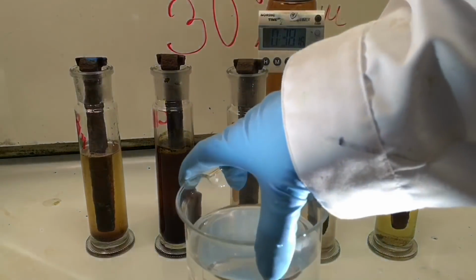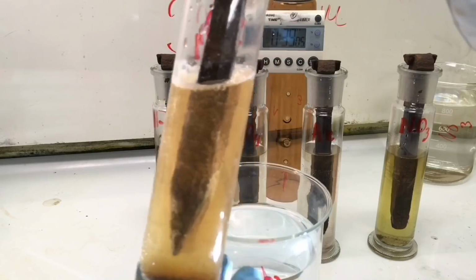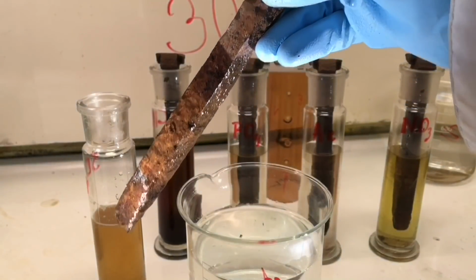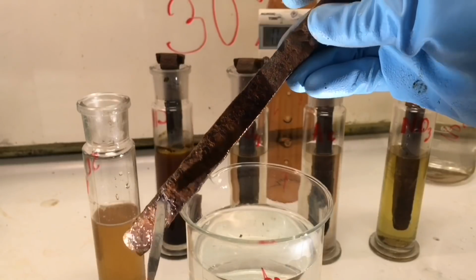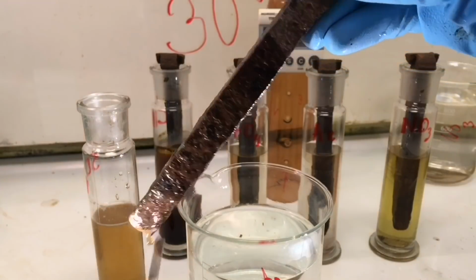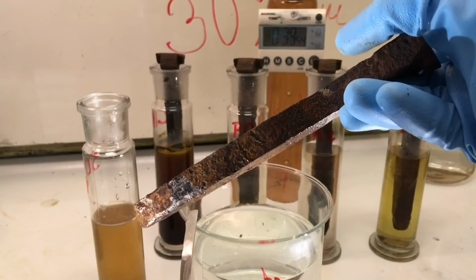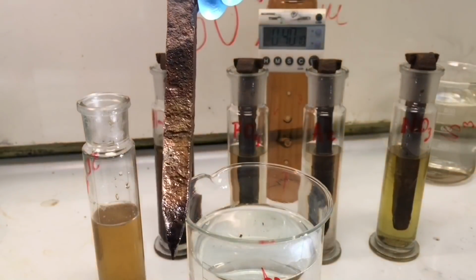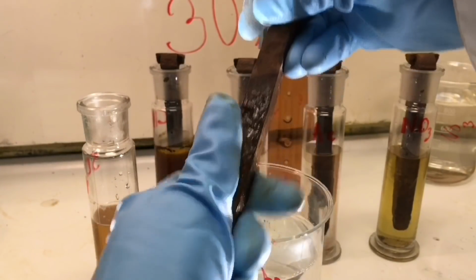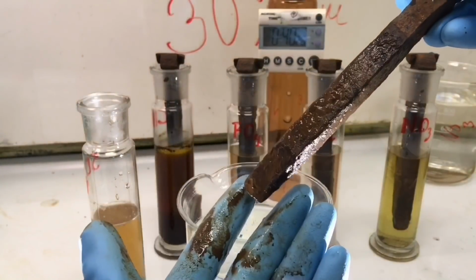And we will move on with the sulfuric acid. Bubbles are formed, a lot of them. Also a slight tendency for having smaller bubbles here. And yes, this little section over here shows iron. Actually also some there, and here is a big piece of rust that has fallen off. There's no marked line like we have in the hydrochloric one up here. I run it on my fingers. See? Yes, there's a lot coming off here. You see, I become completely dirty.